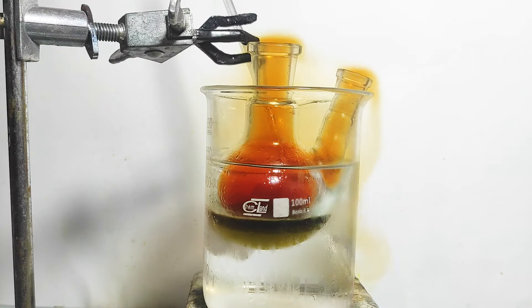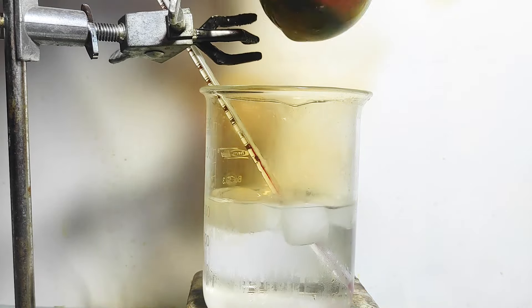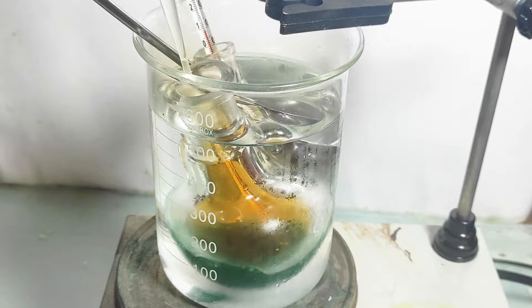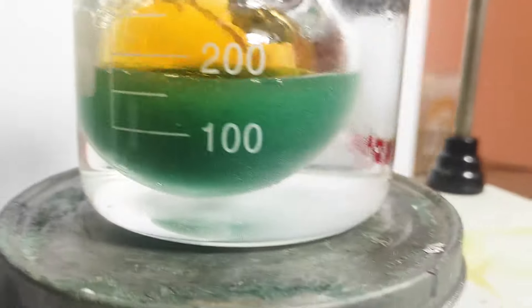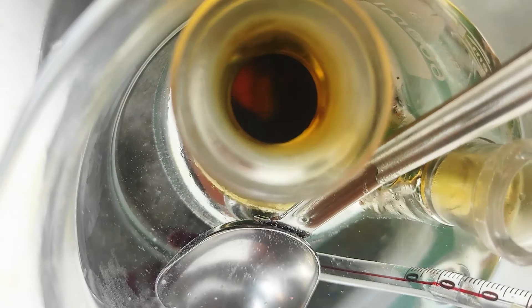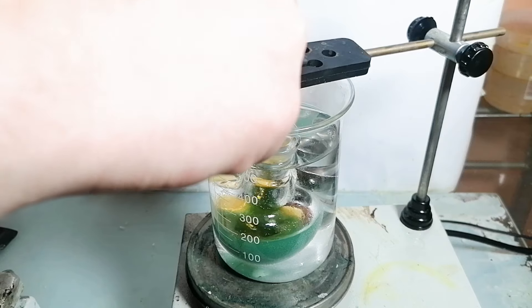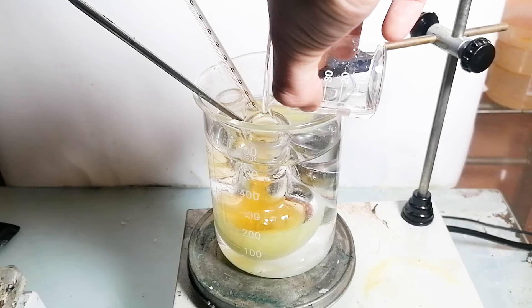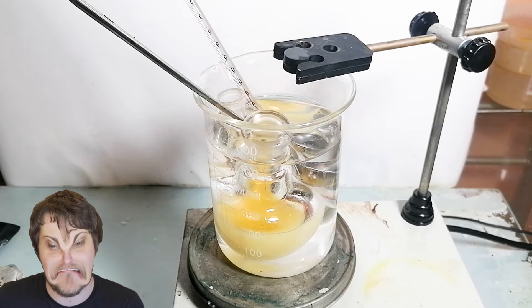Eventually the whole mixture took on a green color, and after I became tired of swirling it around constantly, I decided to upgrade to a stir bar. Here's a really cool close-up shot which really shows this green emerald color of the solution. As the concentration of the nitric acid decreases because some water forms overnight, its power decreases as well. So now it was safe to just add the benzyl alcohol into it, which surprisingly turned the mixture's color yellow, which is really nice.